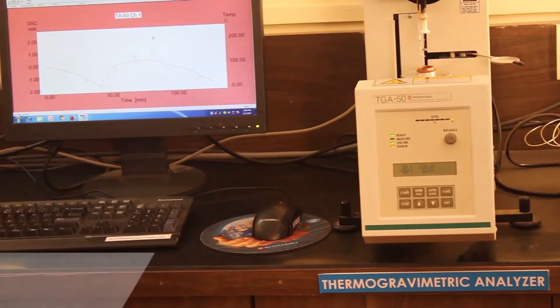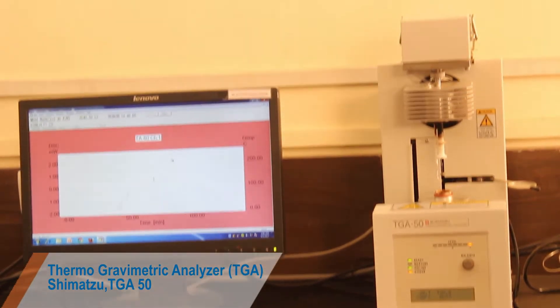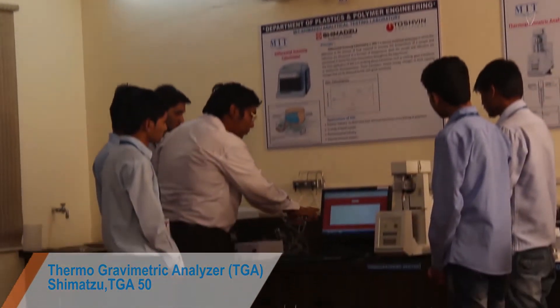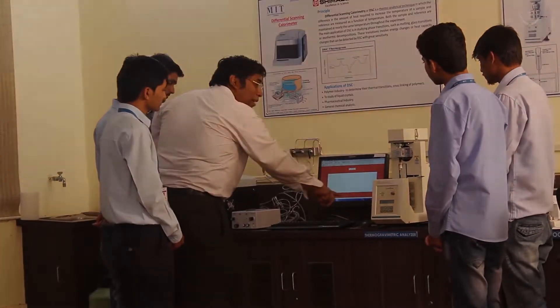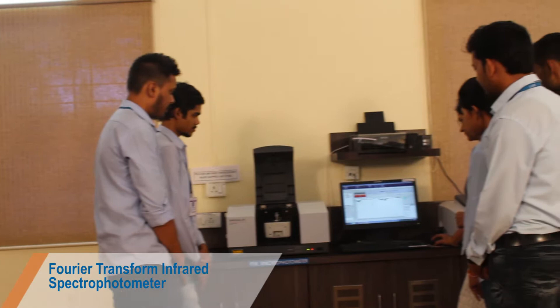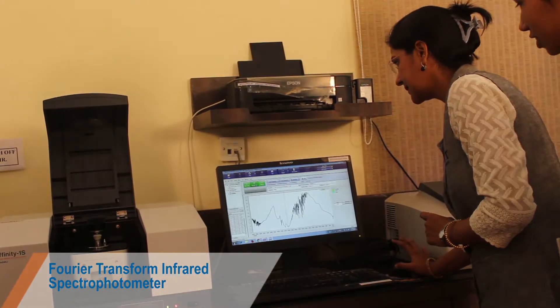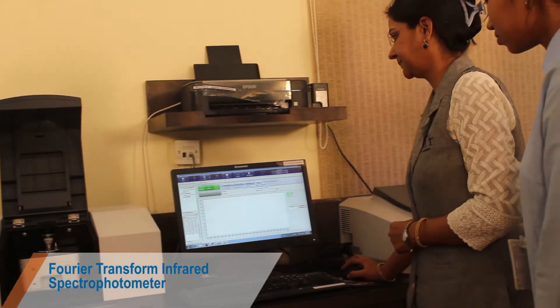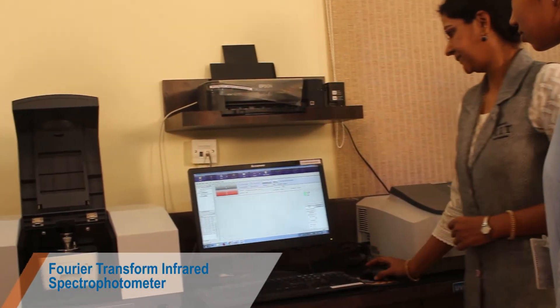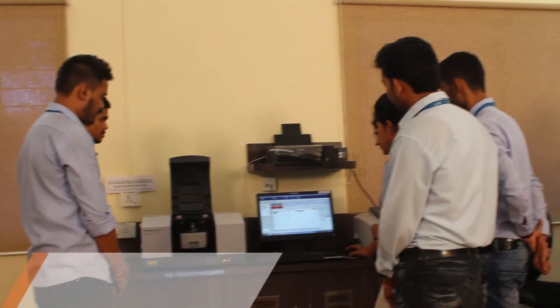TGA is a method of thermal analysis in which changes in physical and chemical properties of materials are measured as a function of increasing temperature, studying weight loss of the bulk drug. Infrared spectroscopy is widely used in industry as well as in research. Major applications of IR spectroscopy are identification of functional groups, structure elucidation, identification of substances, studying the progress of the reaction, and detection of impurities.